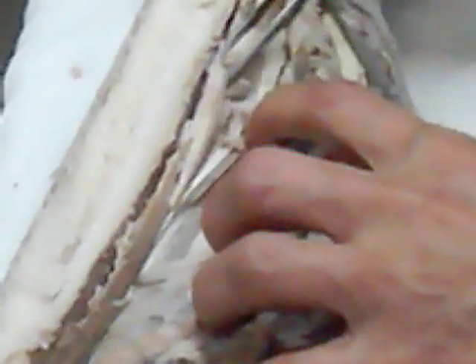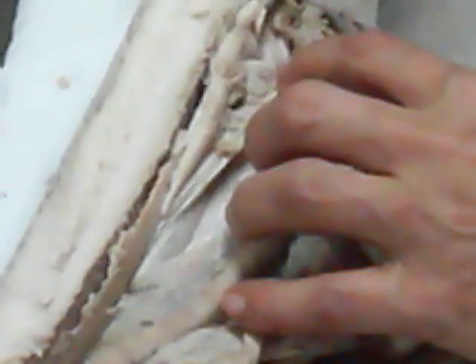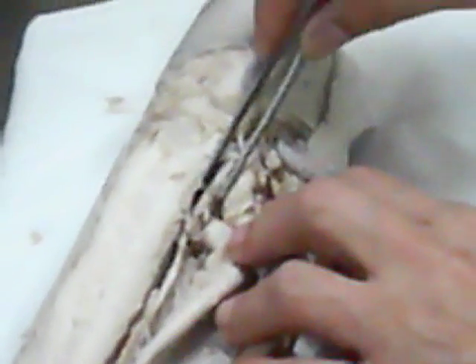The epididymal duct becomes less coiled, and once it becomes less coiled, we call this the ductus deferens. Then it becomes bigger in diameter, and once it becomes bigger in diameter, it's now called the seminal vesicle. The one dorsal to it is the opisthonephros.